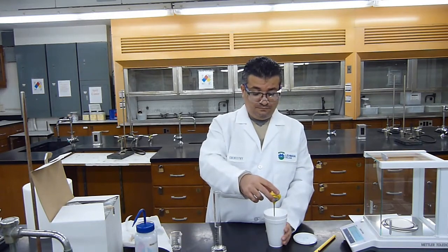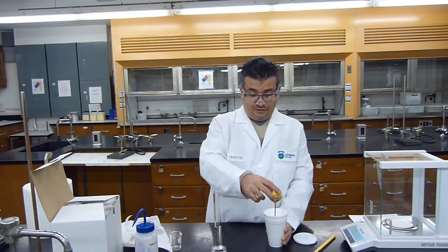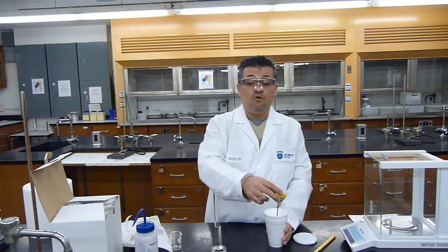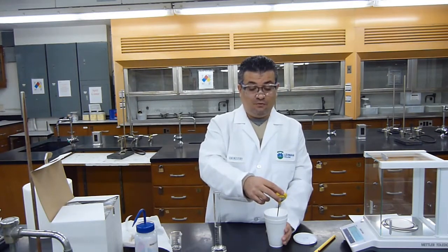So the temperature is decreasing. I'm waiting for it to stabilize. And now the temperature of my acid is 24.6 degrees. It just went down to 24.5.